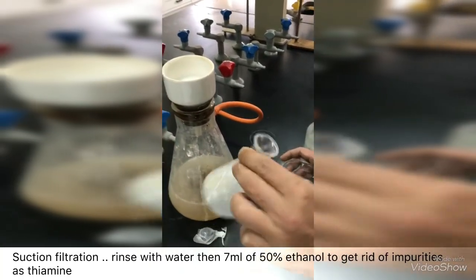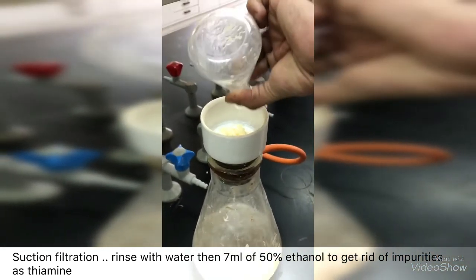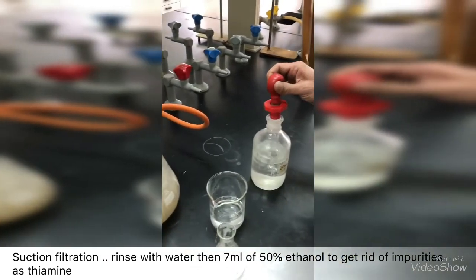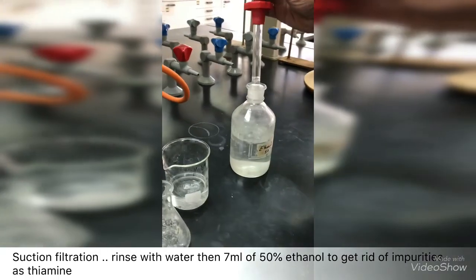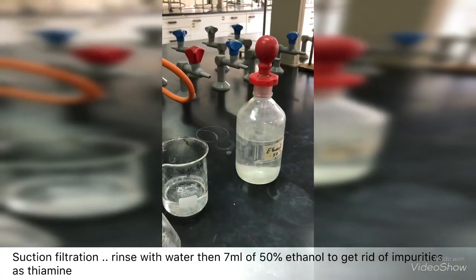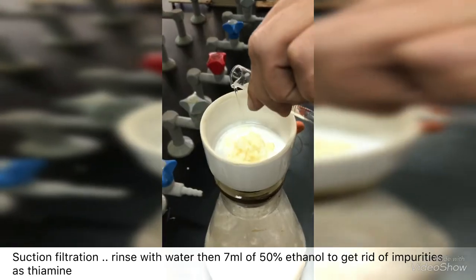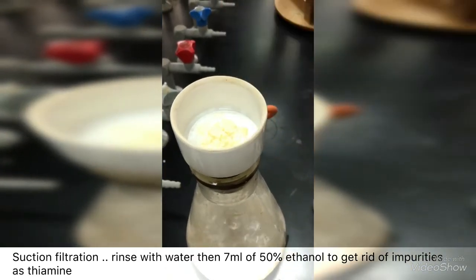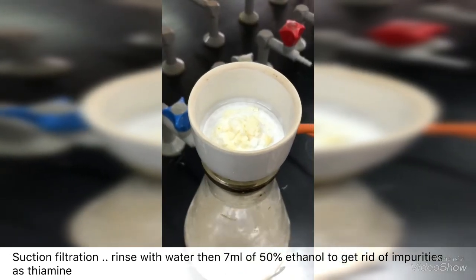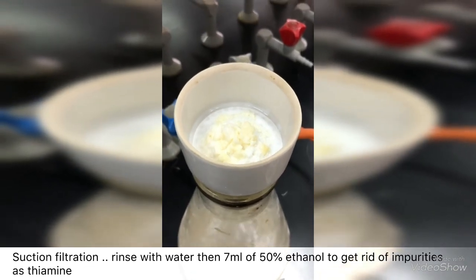Rinse it with some water. Now, add the 7 ml of 50% ethanol. Now, put your crystals on a filter paper to dry for the next lab.